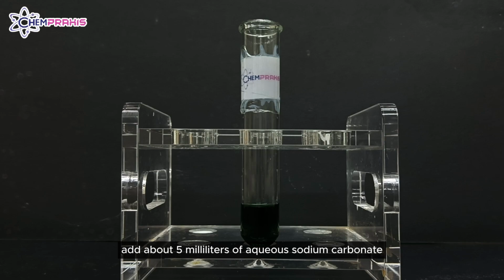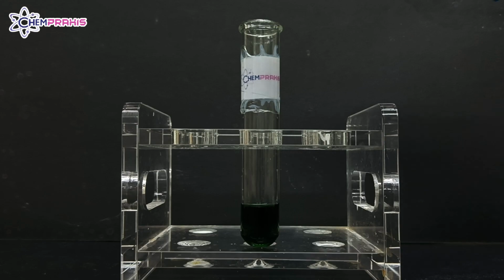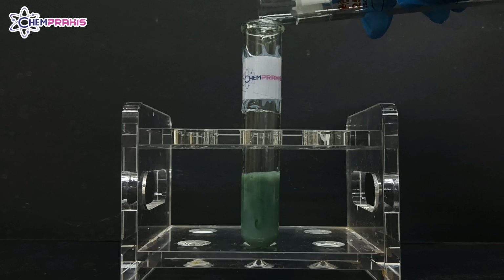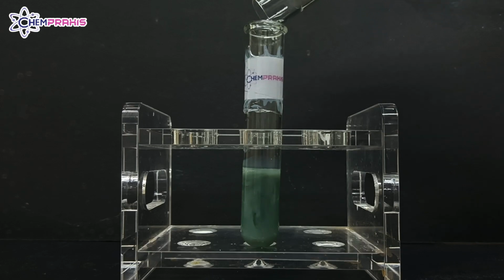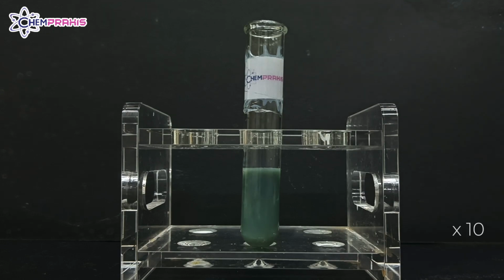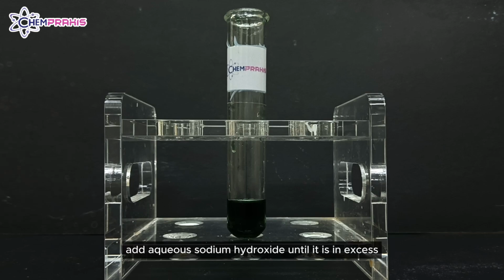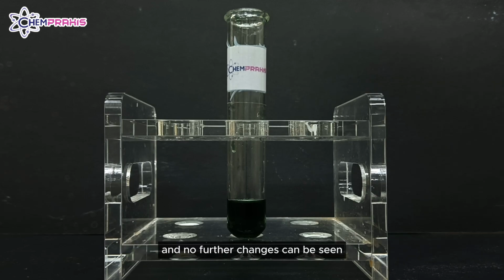Add about 5 milliliters of aqueous sodium carbonate. There will be fizzing and gray-green precipitate is formed. Add aqueous sodium hydroxide until it is in excess, and no further changes can be seen. We can see that green precipitate is formed and the green solution is produced.